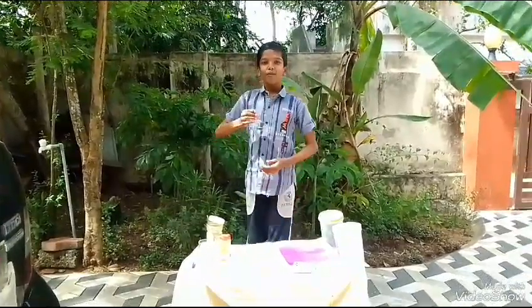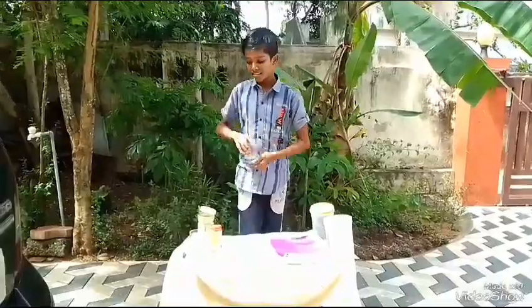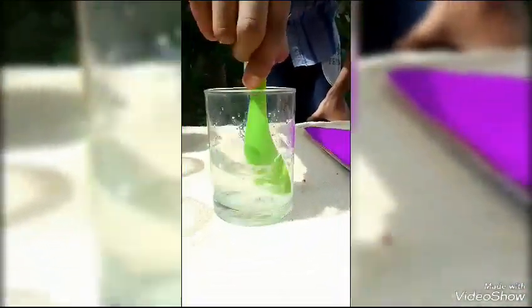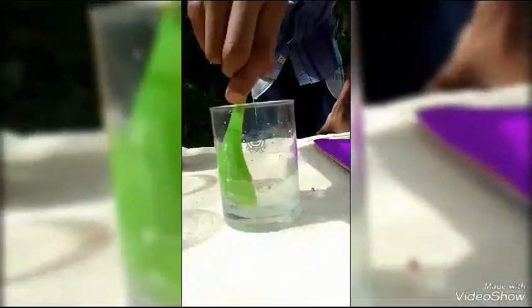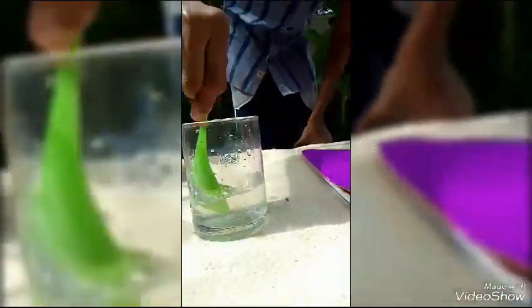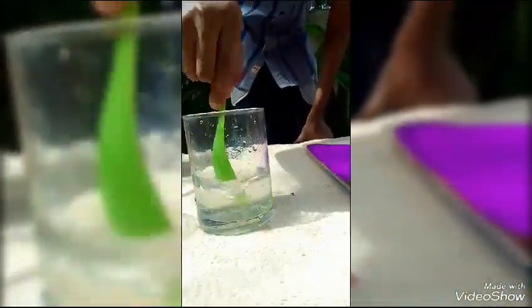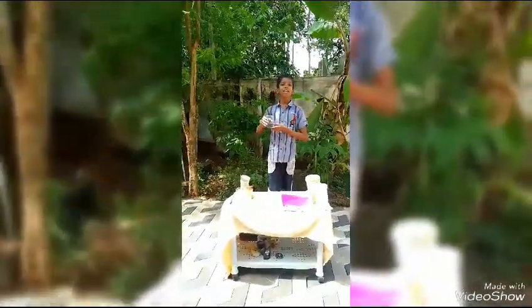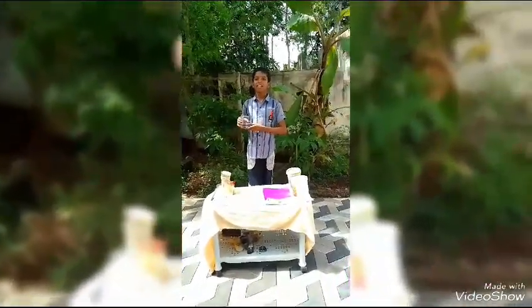Next, we will check the solubility of sugar. Sugar dissolves in water.